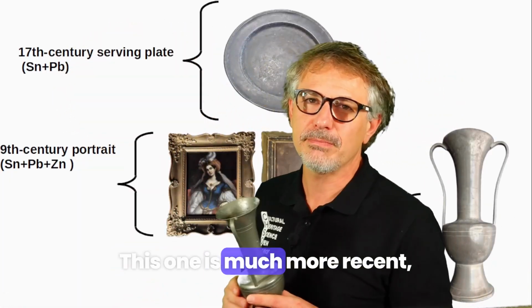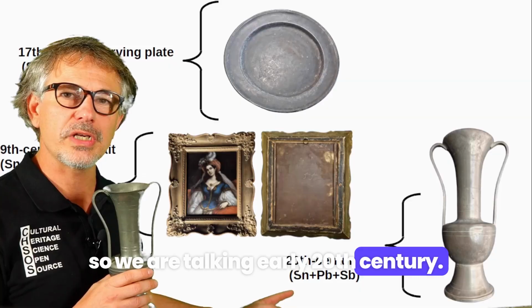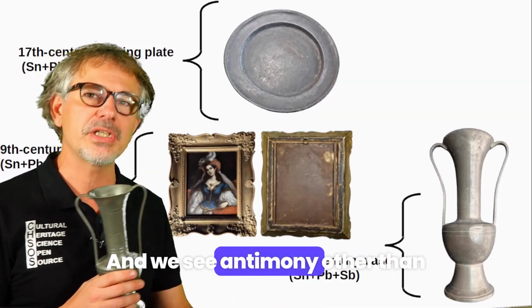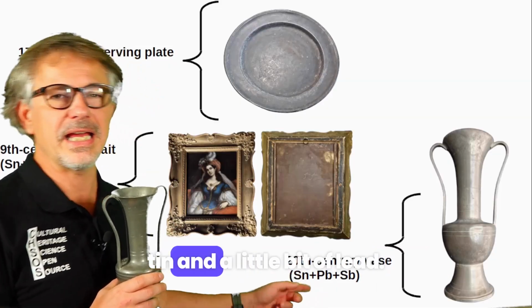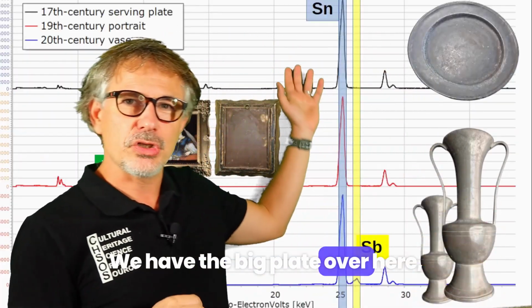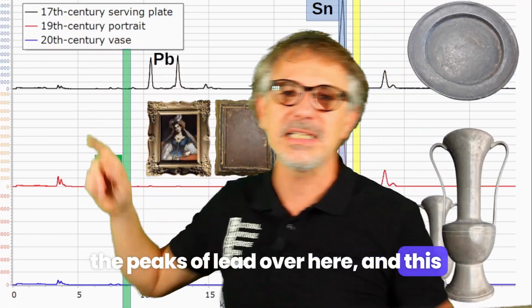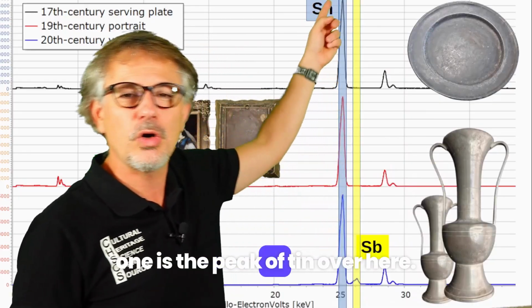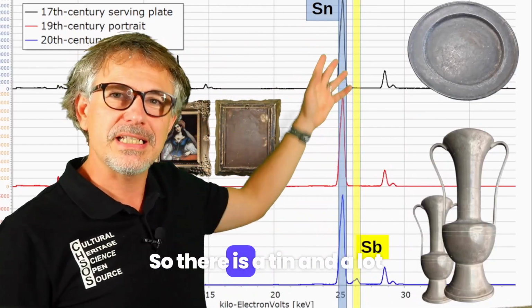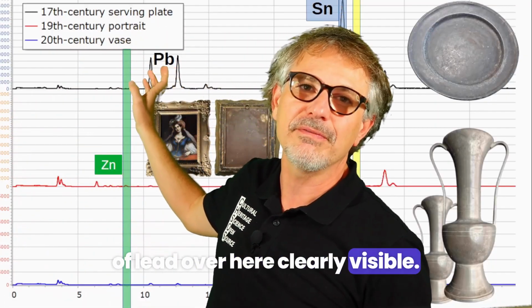This one is much more recent, so we are talking early 20th century, and we see antimony other than tin and a little bit of lead. We have the big plate over here, the peaks of lead over here, and this one is the peak of tin over here. So there is tin and a lot of lead over here, clearly visible.